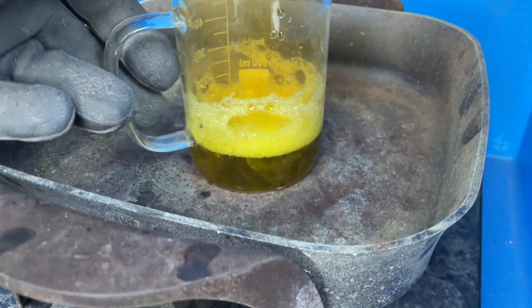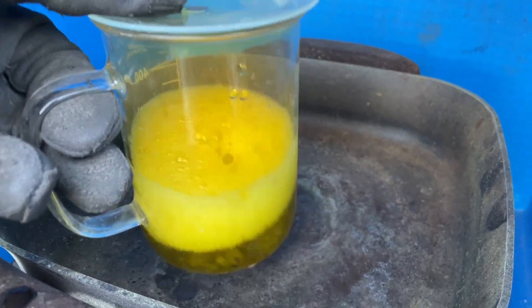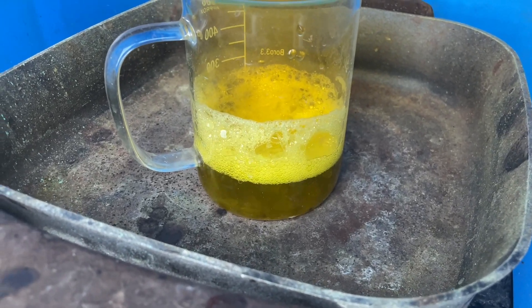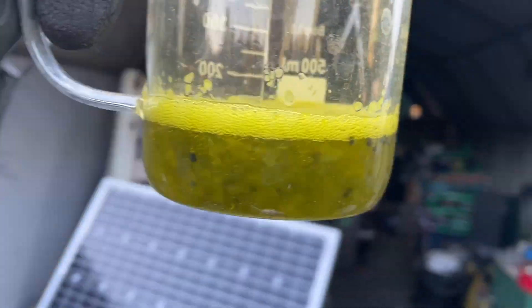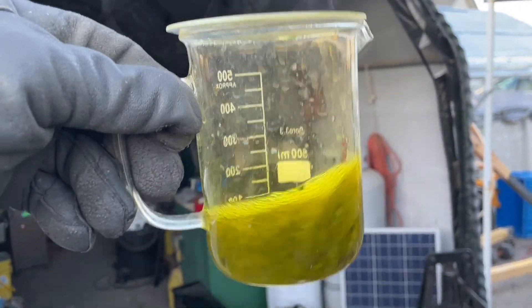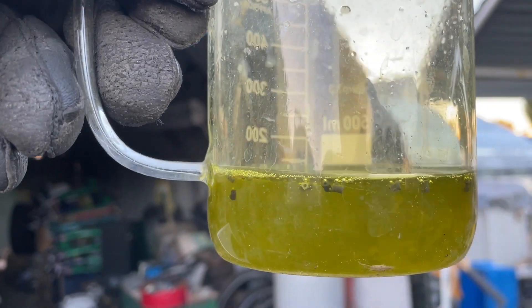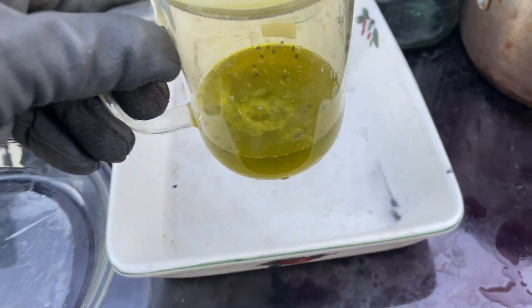She's crashing now. I don't want to add any water if I don't have to — I want a nice strong solution that's loaded with gold. You can see that filter is all coming apart now. Yeah, it's about had it. I think we got it there folks. You can see some of that plastic junk floating around, and the filter paper is about disintegrated.